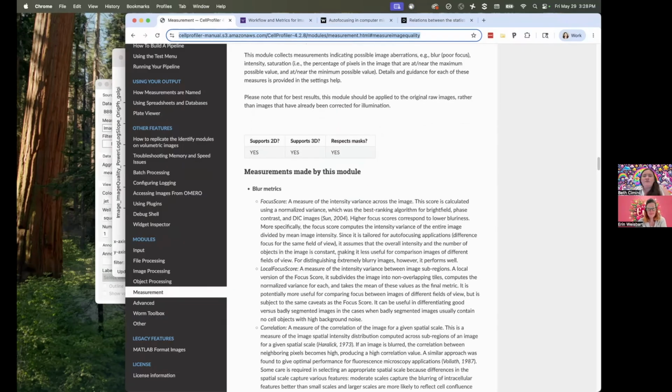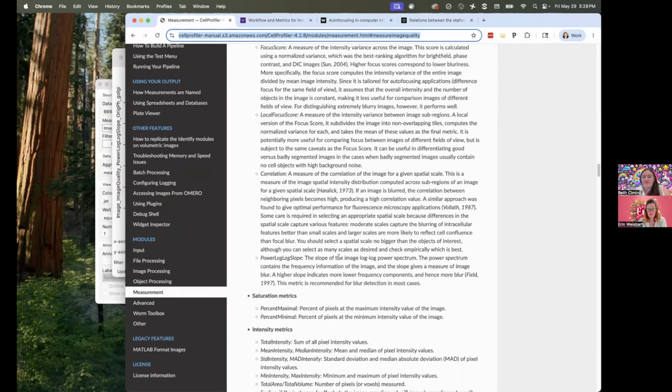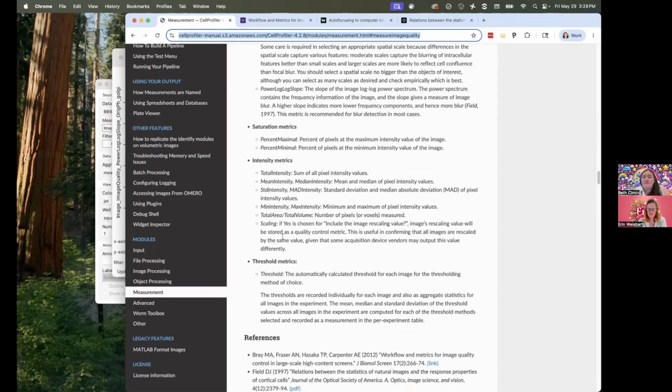So there's a few different kinds of quality measurements that Cell Profiler makes in Measure Image Quality. I'm going to start with some of the easier ones to talk about, which are not the blur ones that were in the original question, but it's important to mention them. The intensity metrics can tell you how much intensity is going on. Generally speaking, that's not going to be a problem, but these are great metrics for seeing if some of your images are really different from the others. So maybe they have a different maximum or different minimum, or maybe there's some accident of metadata going on and they're scaled differently. That would be potentially really dangerous. So these aren't ones that are going to be good for checking things like, is my image blurry? But they might indicate overall problems, like maybe you've accidentally mixed in some 8-bit images with your 16-bit images or something like that.